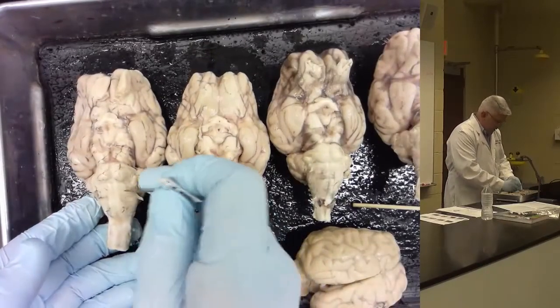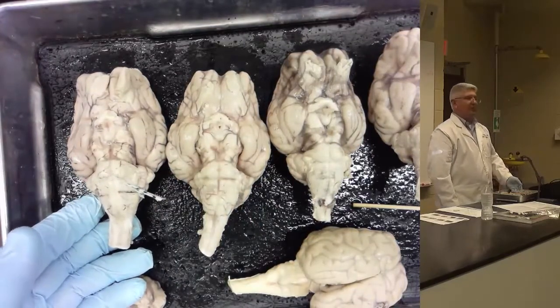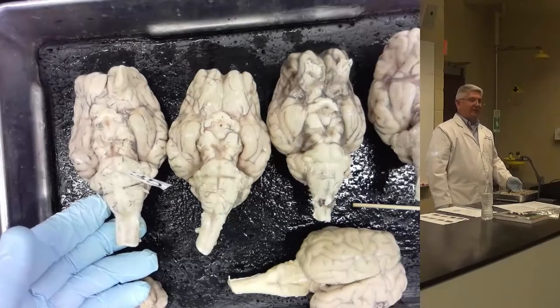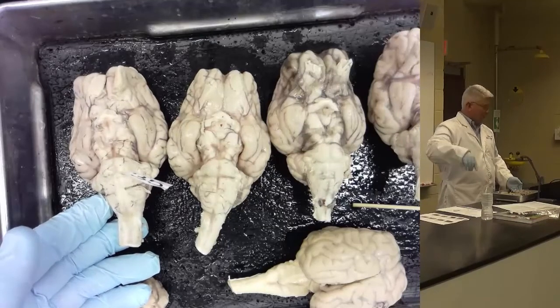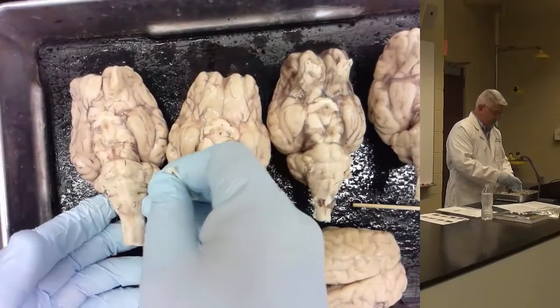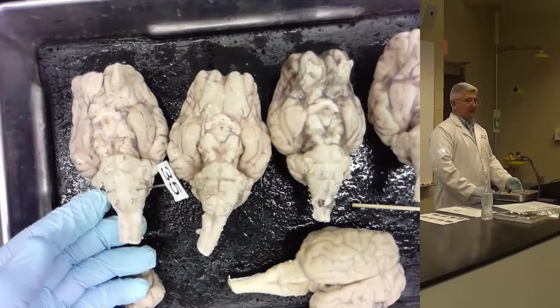So if I were to mark a pin here, it doesn't say sulcus or fissure, so you're not confused that it's in that. It's not a gyrus, so it doesn't say gyrus. It's just a structure. That would be the pyramid. If I have the pin marked way over here on the lateral side, that is the medulla.